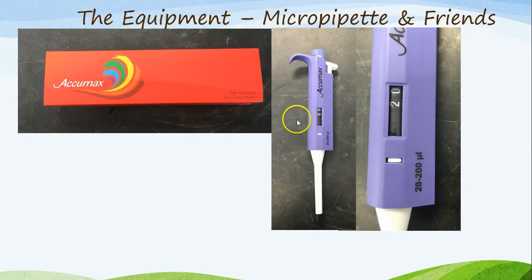Let's familiarize ourselves with the actual micropipette. What you have here at the top is a dial. This dial right here changes the amount of liquid that can be drawn into the micropipette. This dial is an indicator of the microliters. By twisting this dial, you can change this value, thus changing the amount of liquid that can be drawn up into a micropipette. Other items of interest.